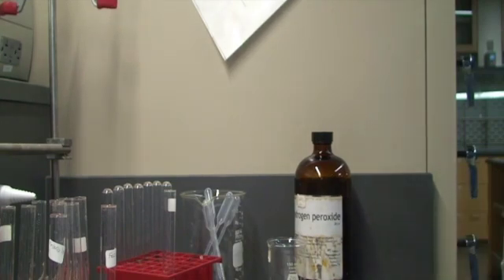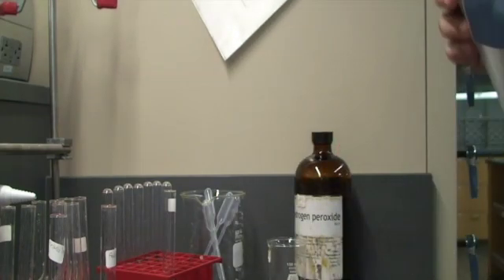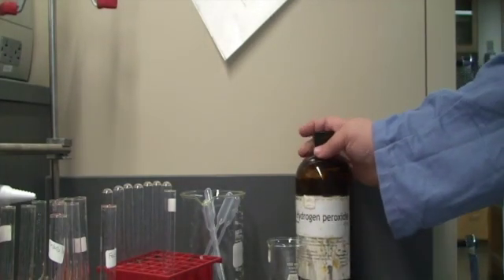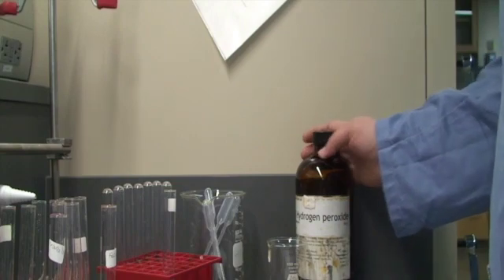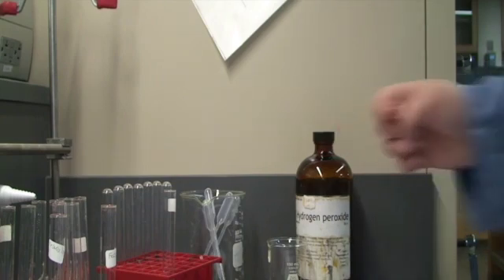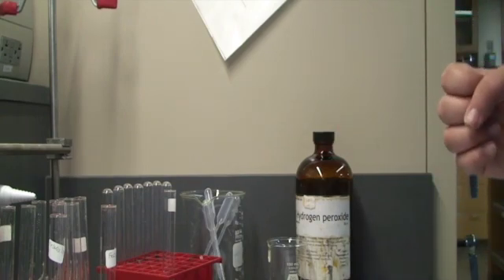Now we're going to move on to part 3. We're going to do some reactions with hydrogen peroxide. I have a hydrogen peroxide sample here. Hydrogen peroxide is sensitive to light, so we have it in this amber bottle, and I was sure to keep it there until we were ready to start working.